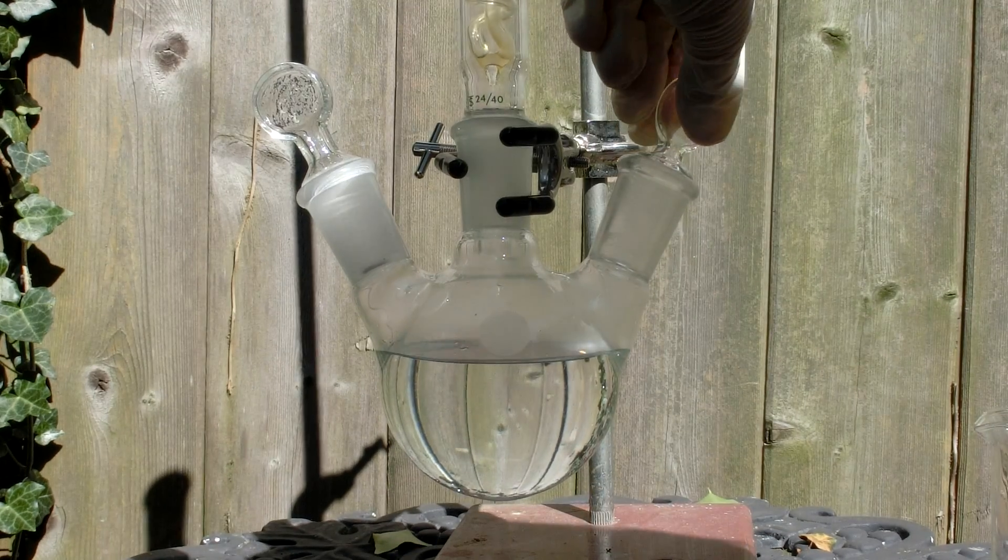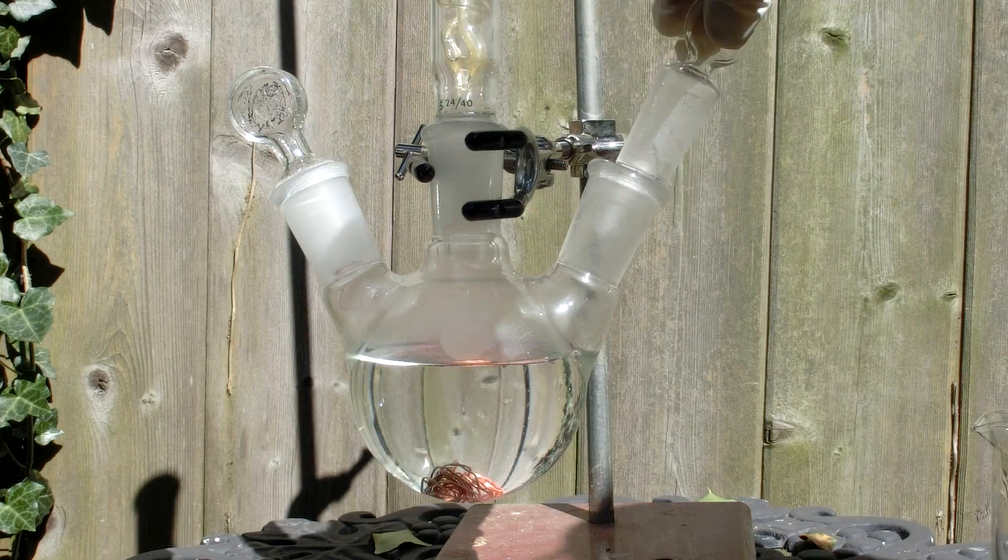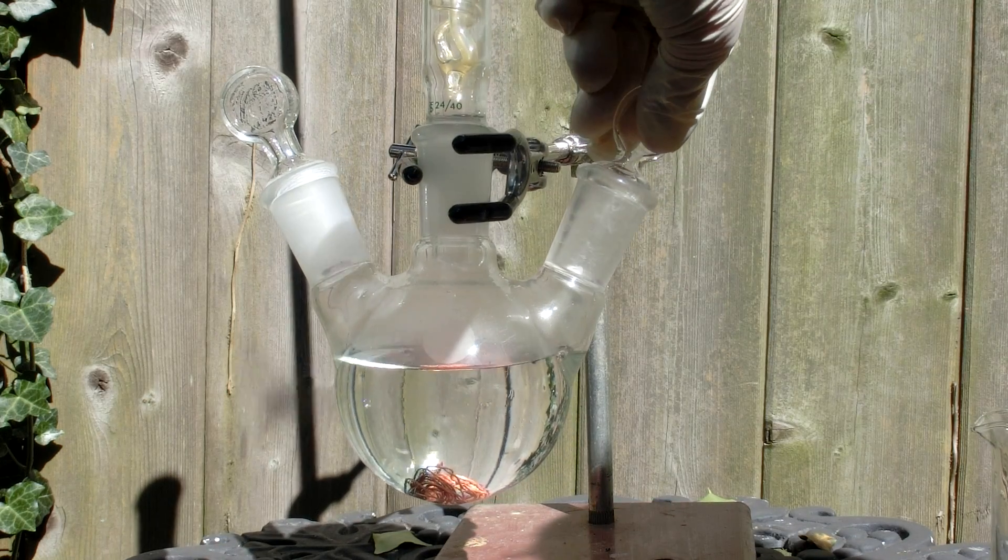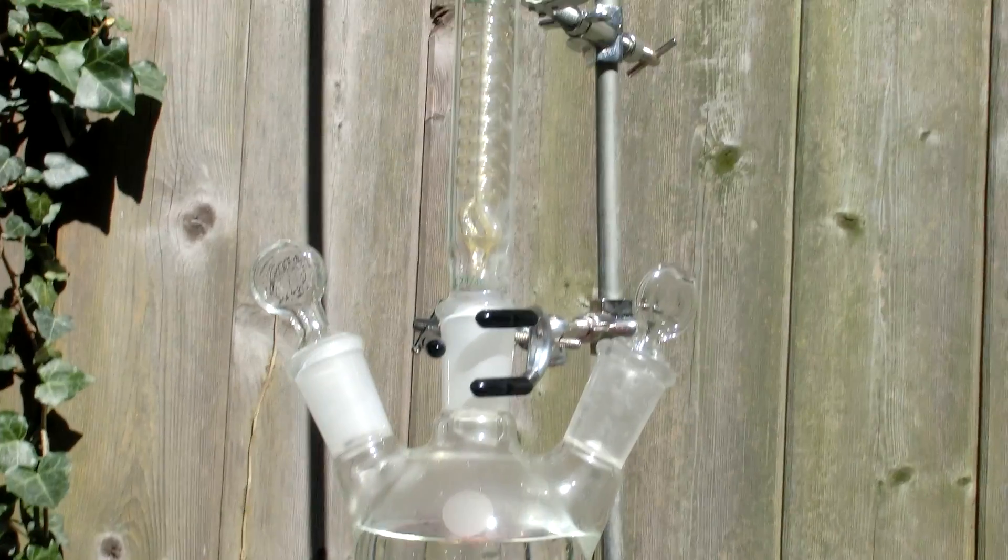Finally, add an excess of copper metal. Here is my setup. I added a reflux condenser on the top just to condense any hydrochloric acid fumes. You don't necessarily need water running through it.